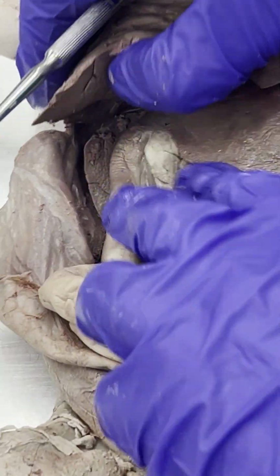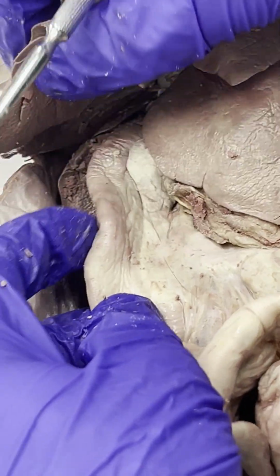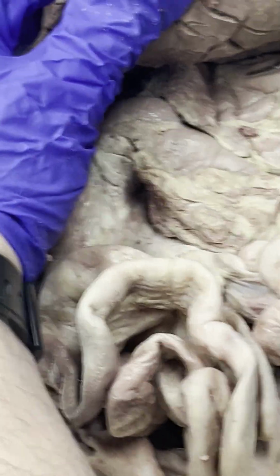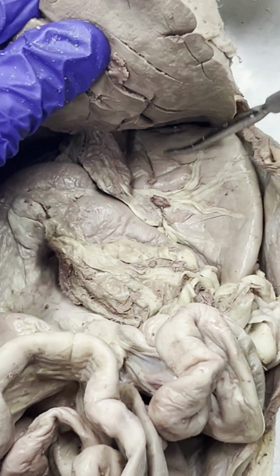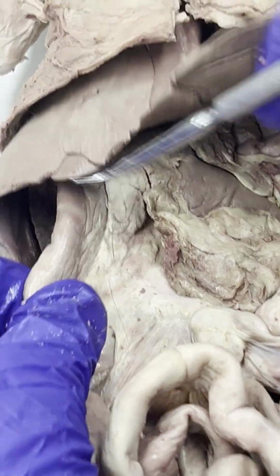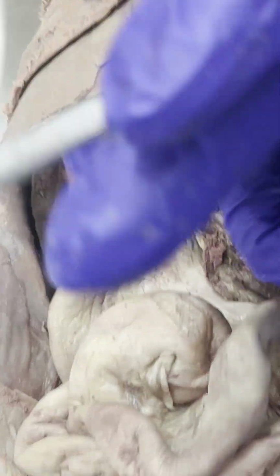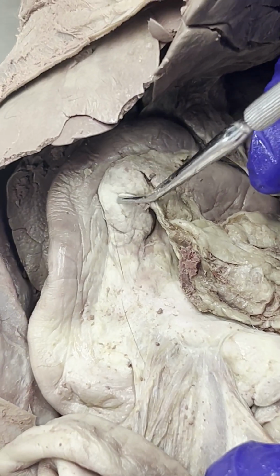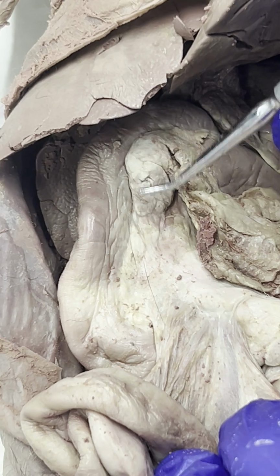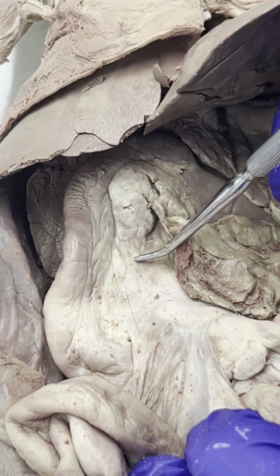The head of the pancreas specifically is going to be attached to the duodenum. So lifting up this liver right here, just to orient you again, here's our stomach. Here's our duodenum right here. But this lighter part right here, a lot going on right here, this lighter part is going to be the pancreas, but specifically the head of the pancreas. The head of the pancreas is attached to the duodenum.